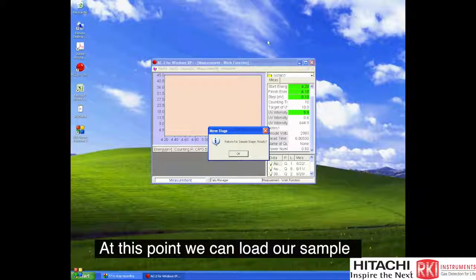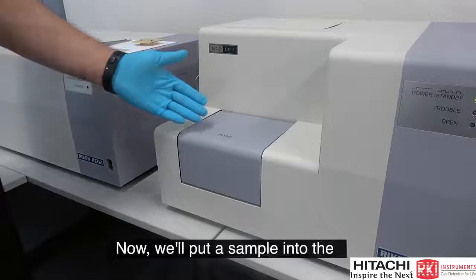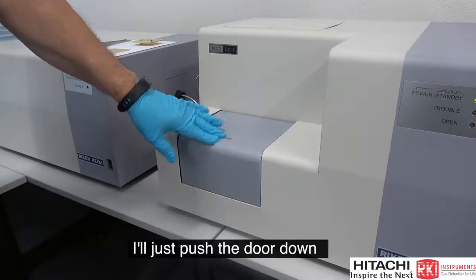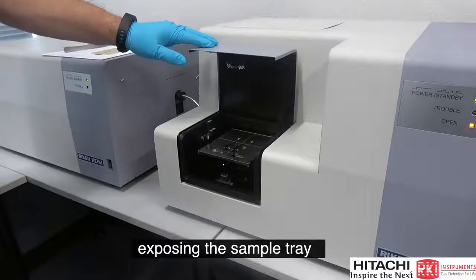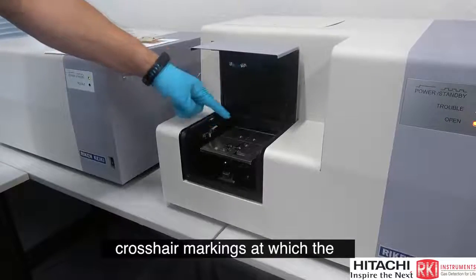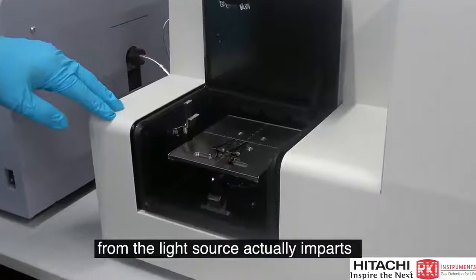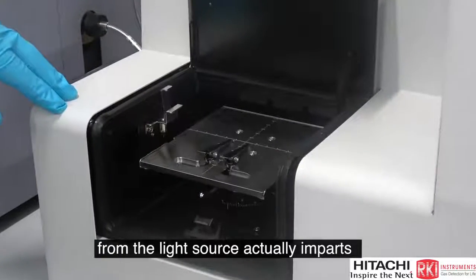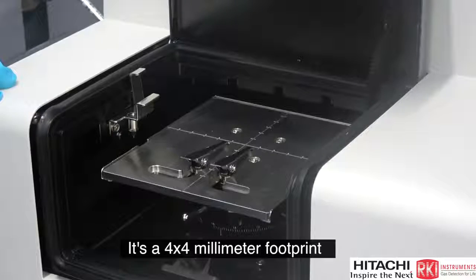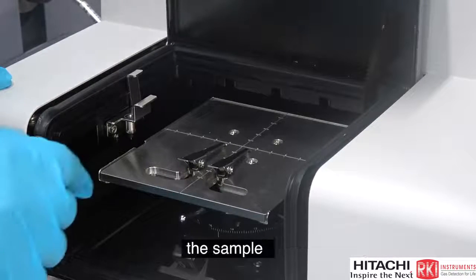Okay, at this point we can load our sample into the AC2. Now we'll put a sample into the AC2 detector console. I'll just push the door down, it kind of rebounds upward, exposing the sample tray. On the sample tray, we can see crosshair markings at which the intersection is where the beam from the light source actually imparts itself on the sample. It's a 4 by 4 millimeter footprint, and that is where it's going to contact the sample.